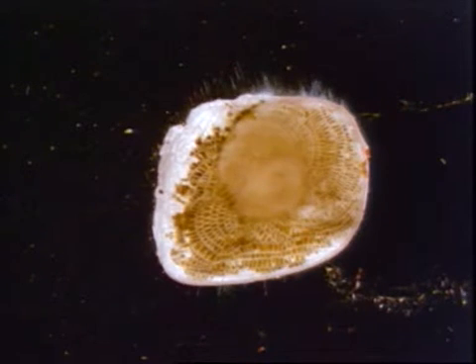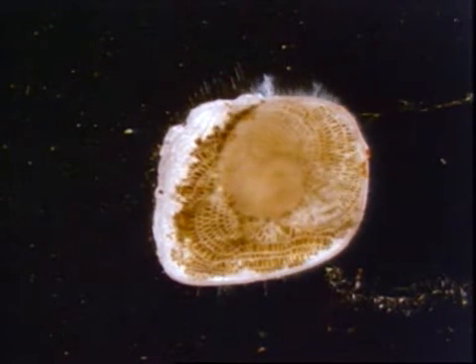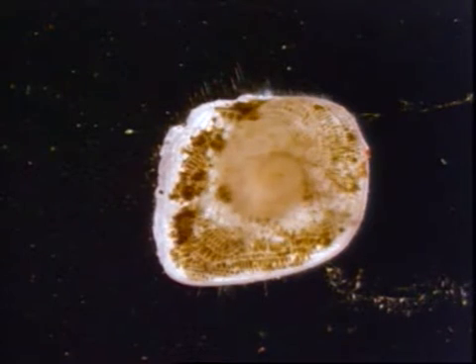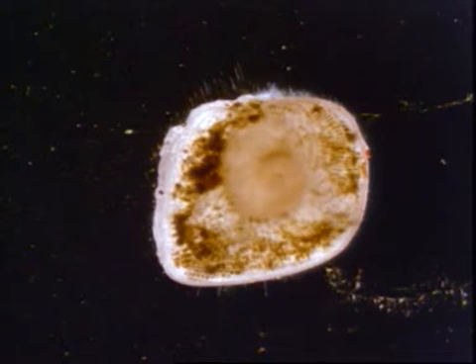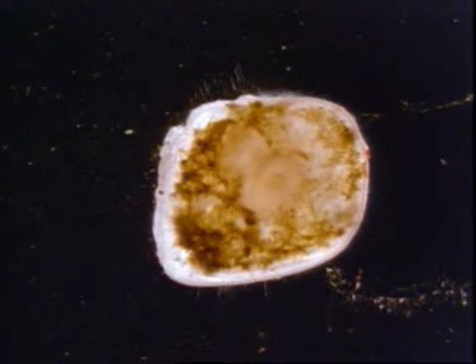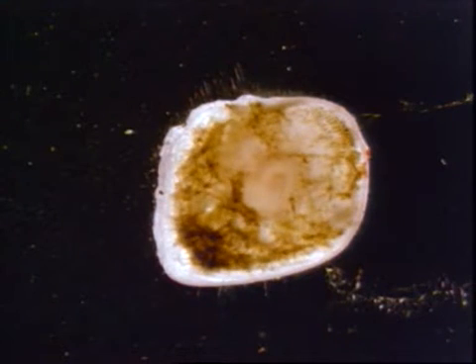Then the protoplasm flows out of the test through the many openings distributed over the entire test surface. The openings are part of a canal system which connects the chamber lumina with the ambient seawater. The protoplasm forms streams flowing criss-crosswise on top of and underneath the test.